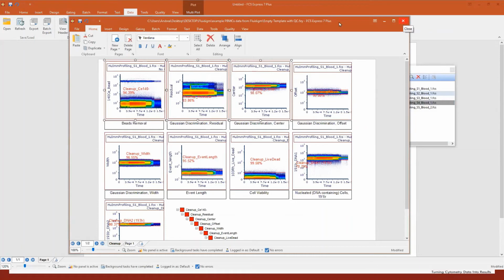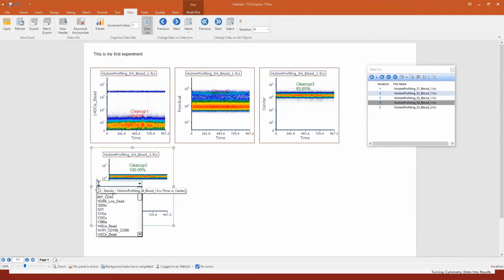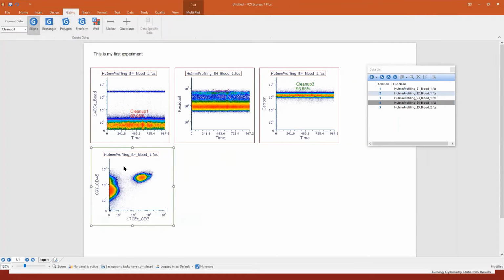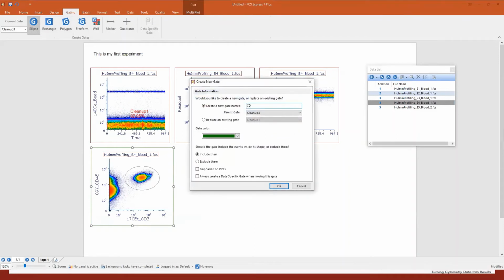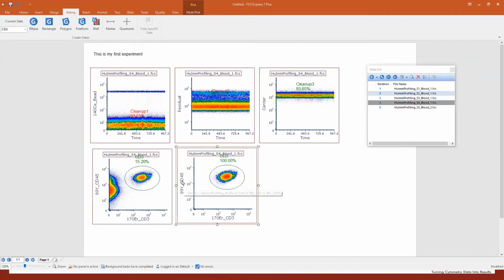What I want to do in this case is to show you final plots just to display some other markers. For example, let's say CD45 and CD3 here. You can create another gate like an ellipse. Let's call this CD3. And then you can move on like CD3 and display CD4, CD8. Here we go.